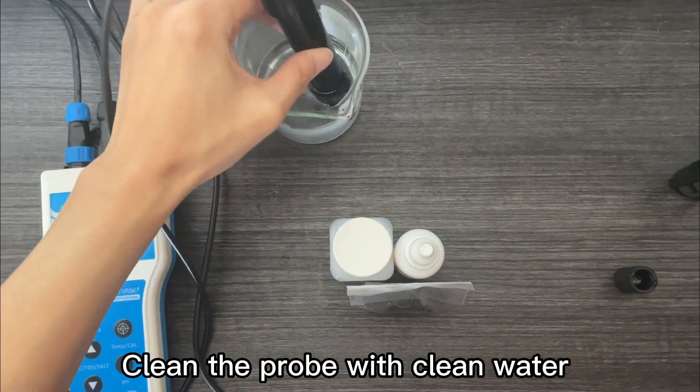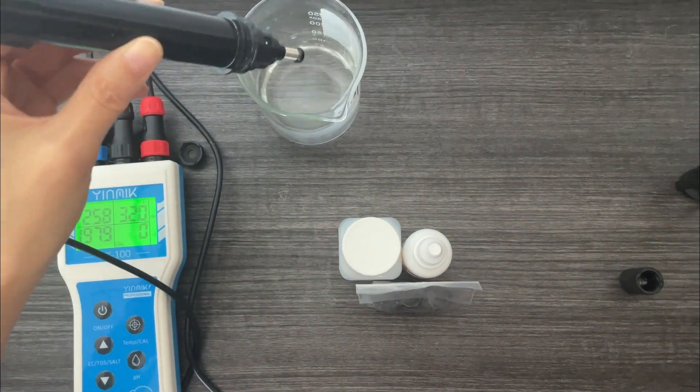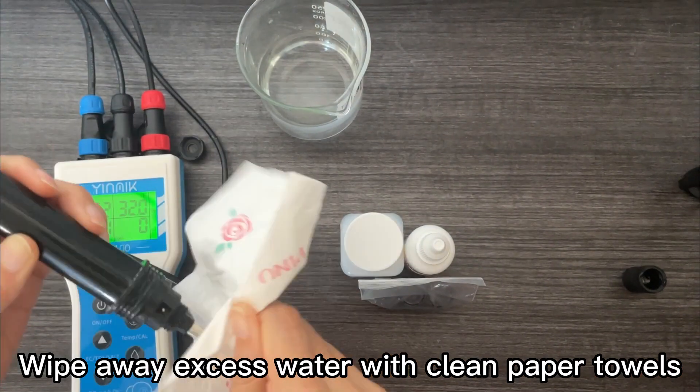Clean the probe with clean water. Wipe away excess water with clean paper towels.